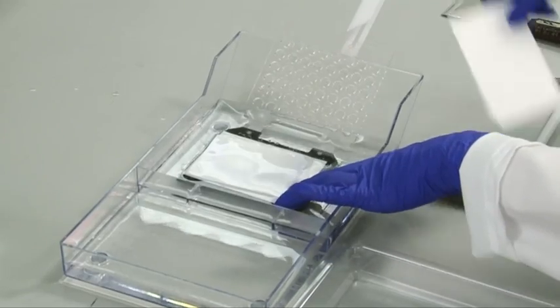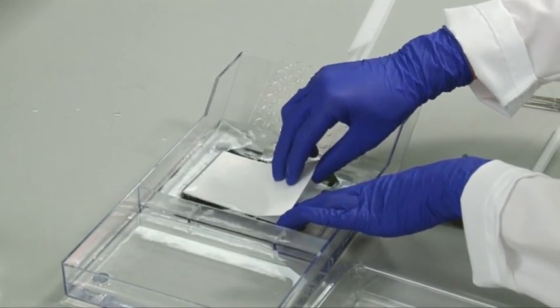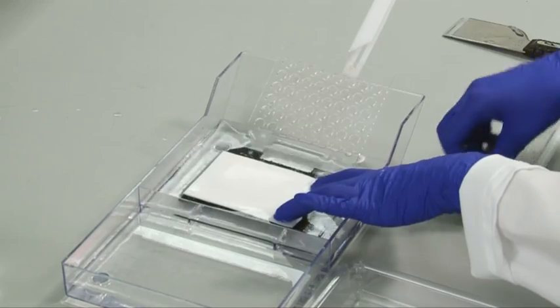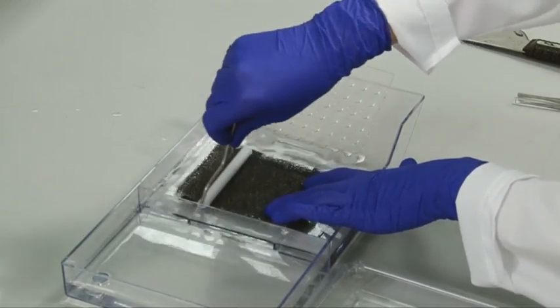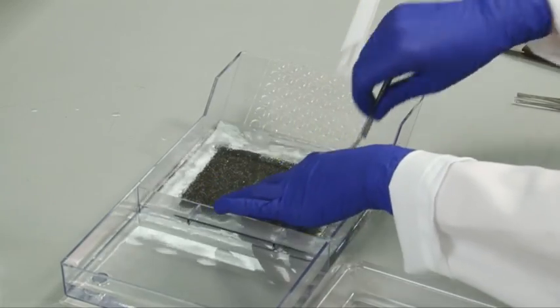Filter paper and sponge. Use a clean roller with each layer to gently roll out any bubbles that may be present, since bubbles will inhibit efficient protein transfer.